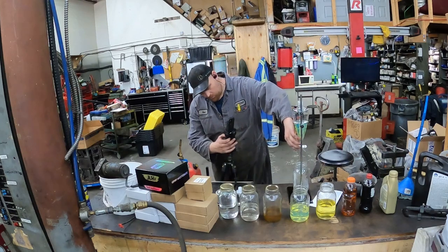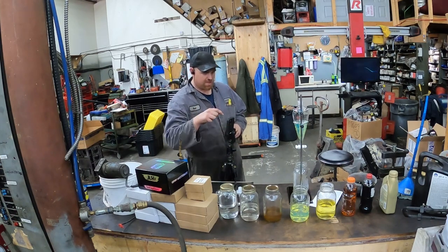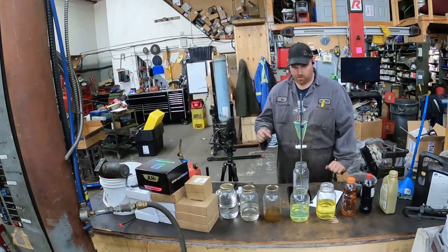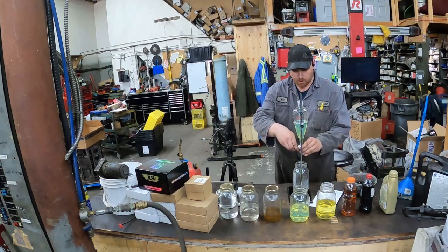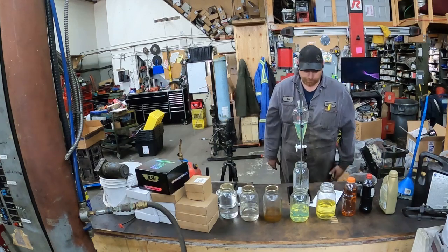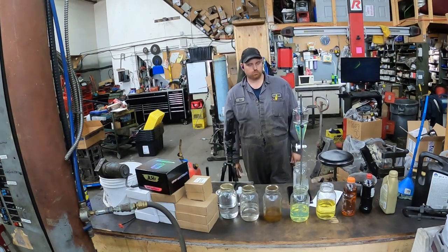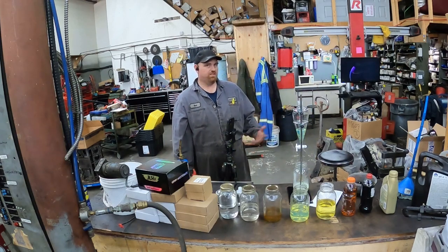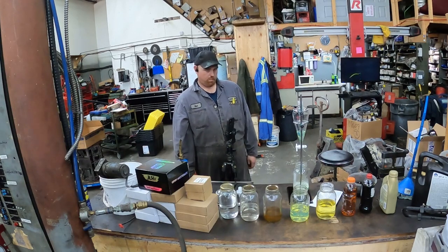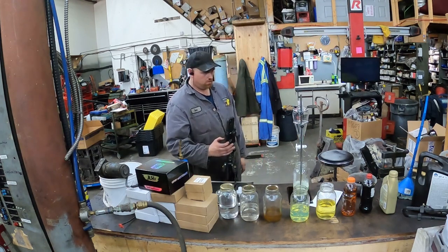I'm going to start this camera, and then when I'm editing it — when the fluid hits the bottom, or when I first turn the valve on. Valve on now, and we'll measure it. Some of this is going to go into time-lapse for you guys because it's going to take quite a while. This is one of the thinner ones going through, so for us to do every one of these it'll take a long time. I'll put it up here as soon as it's empty. Okay, so that was the diesel fuel.